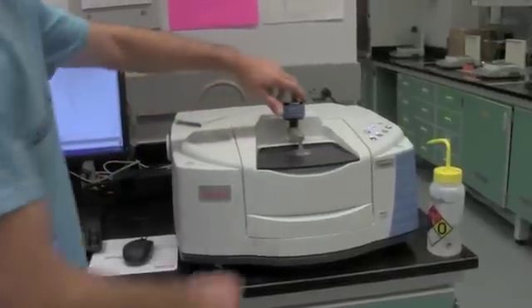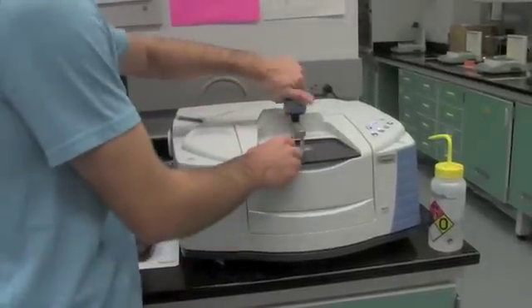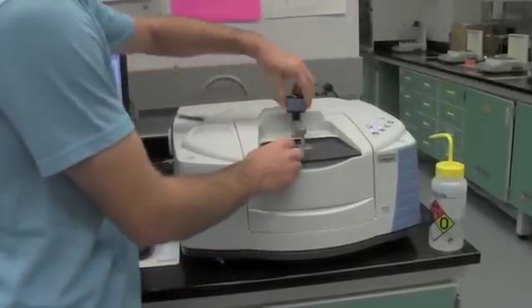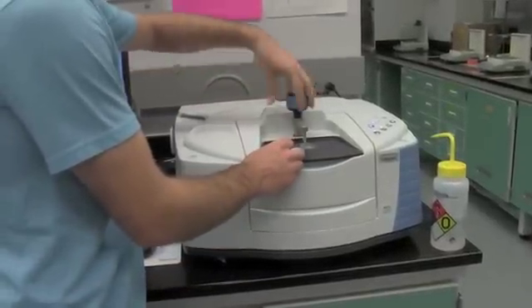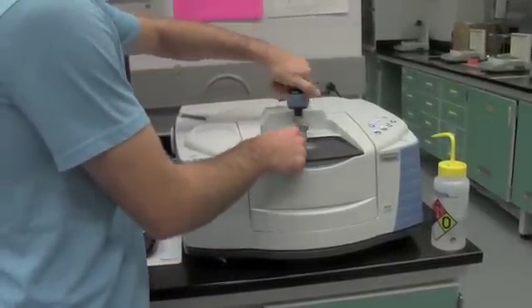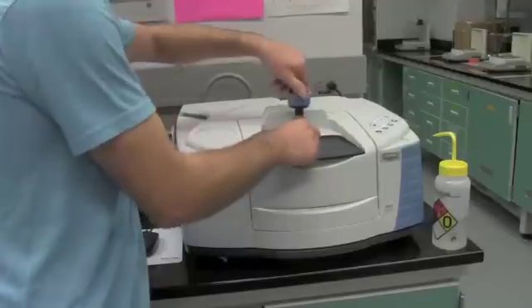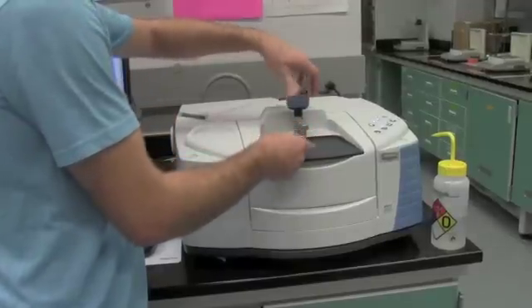Now the sample should be removed from the device by simply unscrewing the clamping device and disposing of the sample.